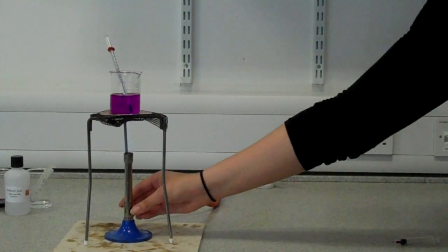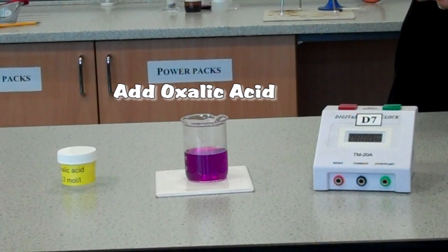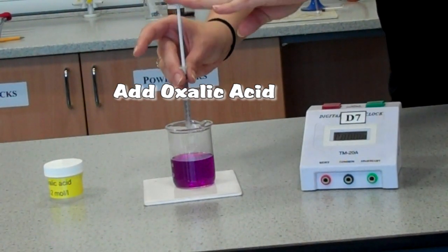The beaker has reached 40 degrees. We add 1cm³ of oxalic acid and begin the timer.